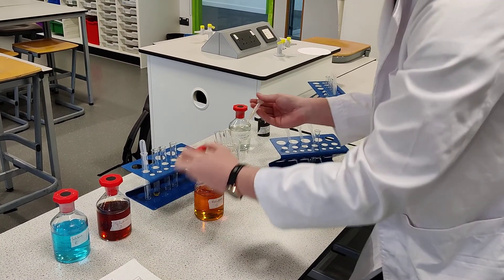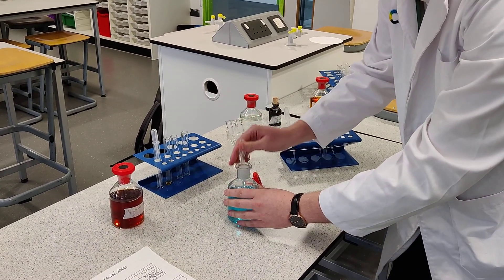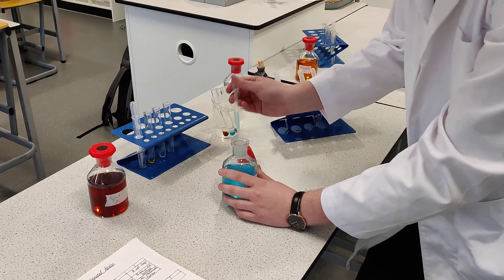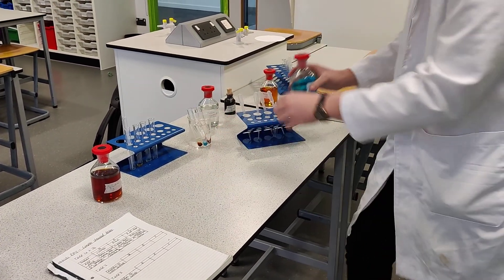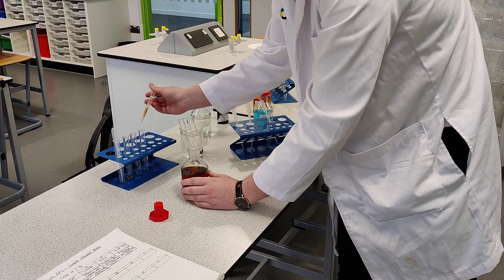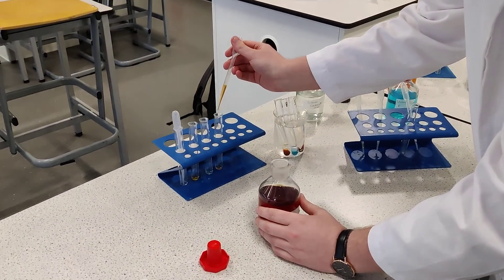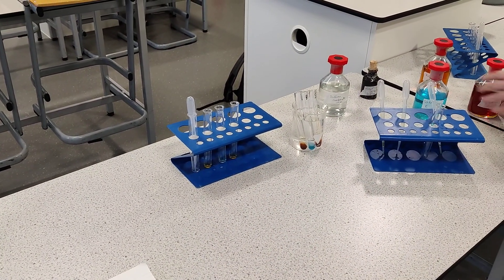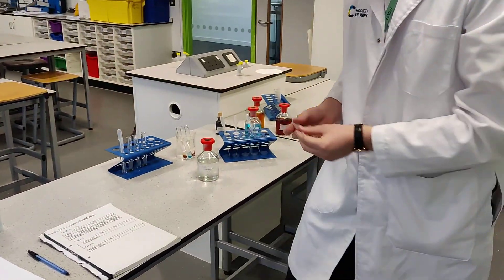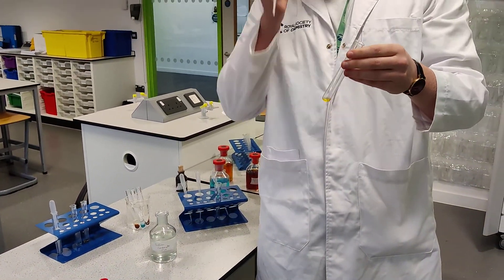That's ten drops of Q, and ten drops of R, and then ten drops of solution S. So what is our second test? The second test is that we're going to be using sodium carbonate. So again, we're just going to be adding a small amount of sodium carbonate to each of these solutions, and we're going to be observing if there's been any change or what happens.